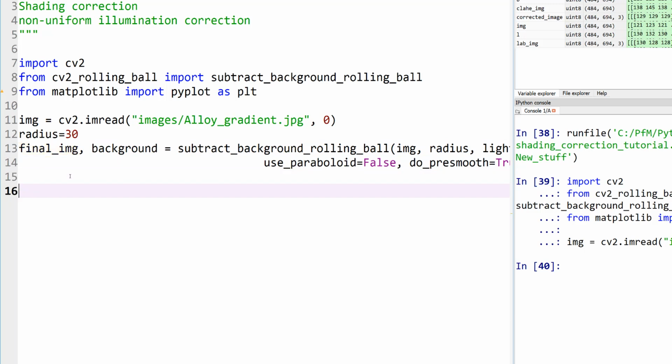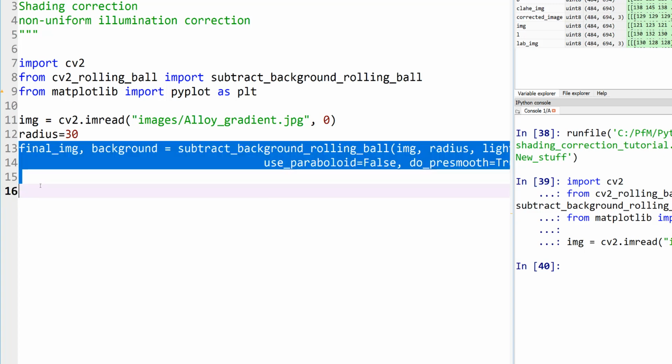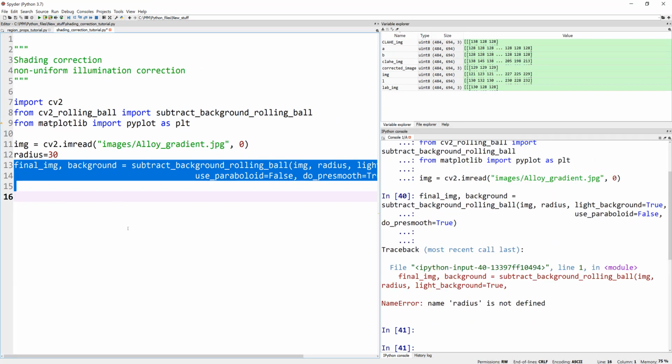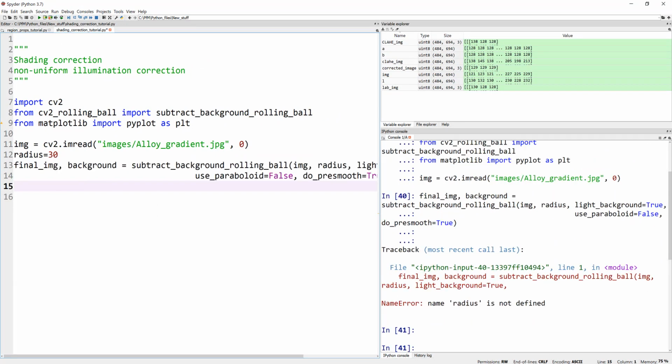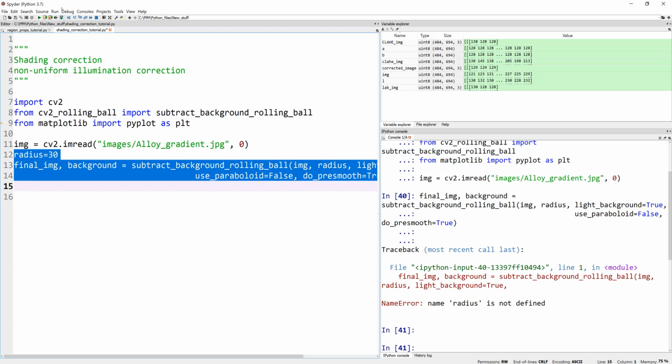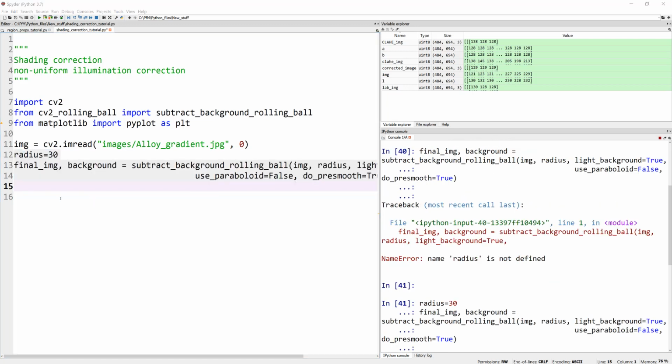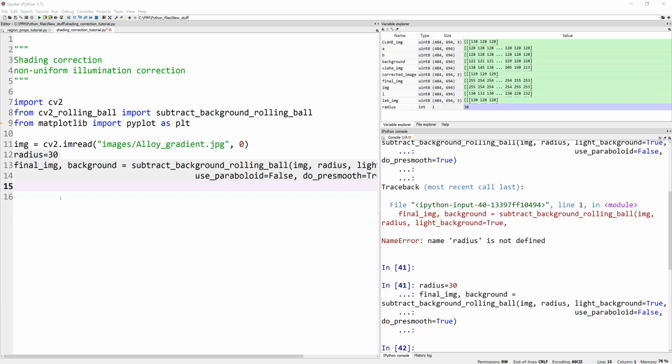Let's go ahead and run this first. This may take a little while because the computation is pretty heavy. So let's run these lines, and I'll probably pause my video and continue in a second. First of all, it says radius is not defined because I haven't run that line. Now let's run it one more time. Okay, there you go, it's done.